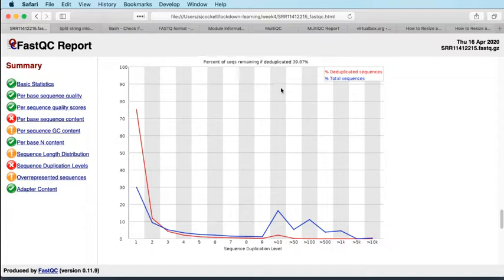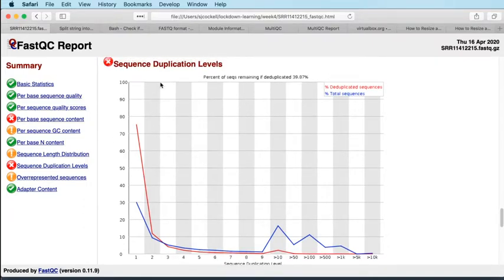This is expected. Sequence duplication: the assumption here is for unbiased genome sequencing, where you expect a low level of duplicated reads, and duplicated reads are indicative of PCR bias. With RNA sequencing, you're sequencing a hugely enriched pool of stuff. Because you're sequencing mRNA, which is, for a start, only 2% of the genome, but also there are certain messenger RNAs in that pool of data that are hugely enriched. So there are certain genes that are expressed at very high levels that will produce a reasonable amount of the data that we're seeing. So you expect to see duplication in RNA-Seq experiments. You expect that a lot of your reads are going to be duplicate reads.